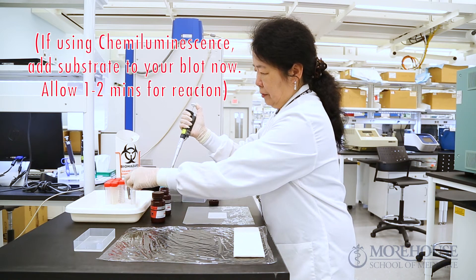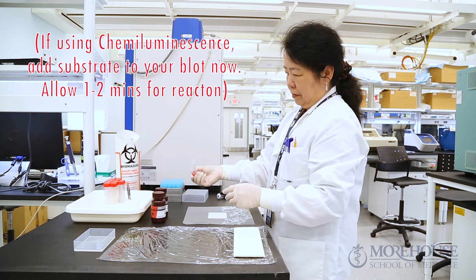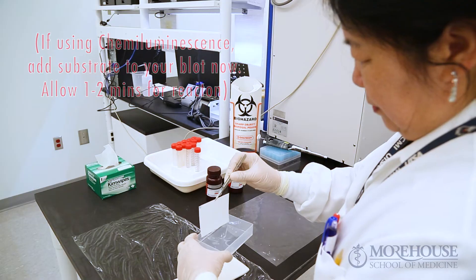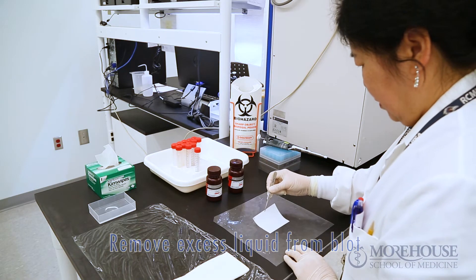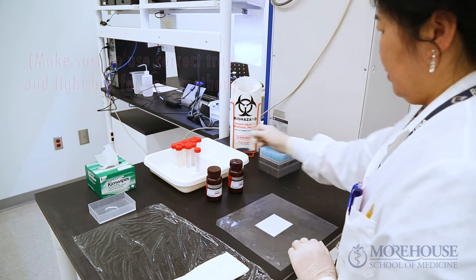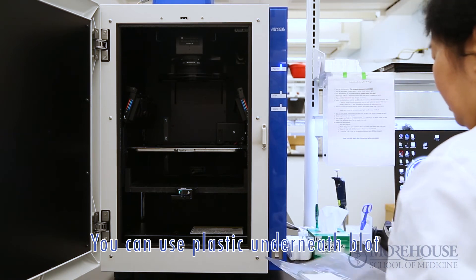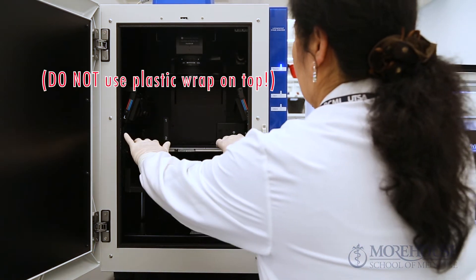If you're using chemiluminescence, you can add substrate to your blot now. Allow to react for 1–2 minutes according to directions for your substrate. Remove excess liquid from blot and place in the center of the tray, face up. Make sure to use the correct tray and lightbox for your method. You can use plastic underneath your blot, but do not use plastic wrap on top.